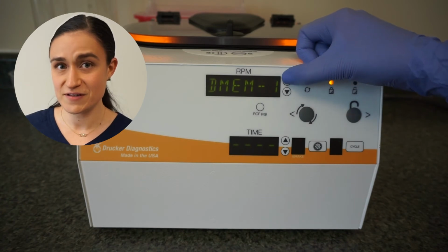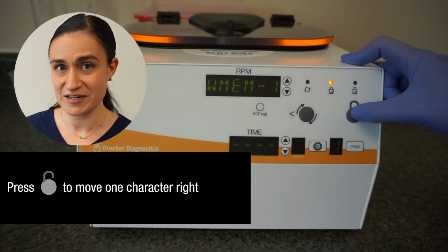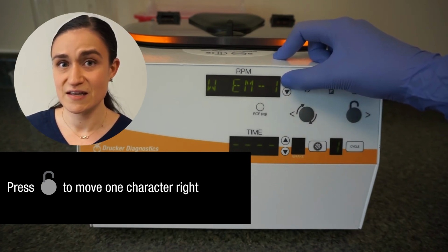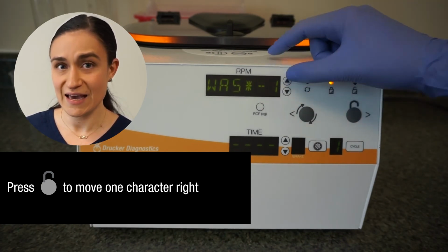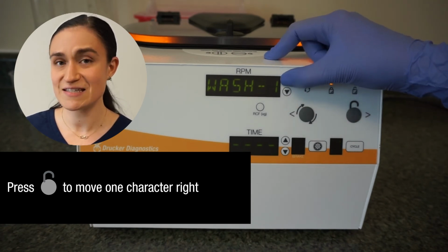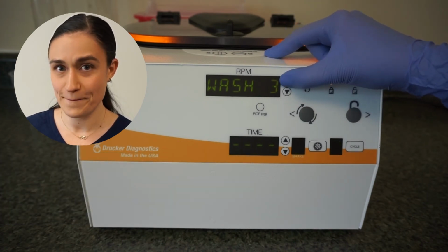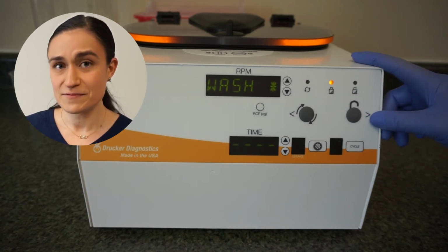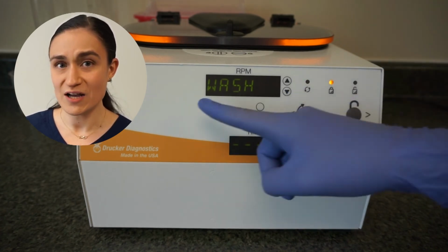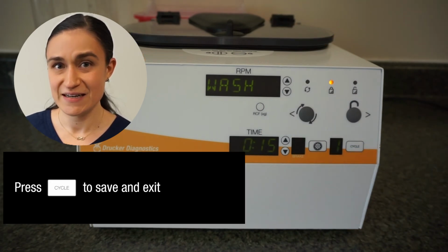Once we've got our first letter, W, correctly in place, we're going to use the Stop Unlock button to move to the right and work on the next character. We're going to repeat this process until we have W-A-S-H spelled out, and then we're going to repeat the process again to select blank characters in the last spaces where the dash and the 1 used to be. Once we've got this process complete and we've got Wash spelled out, we're going to press the cycle button to save it.